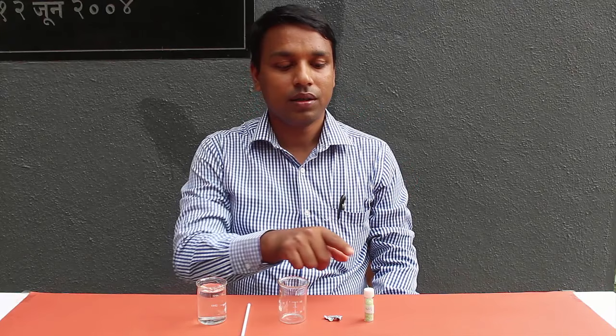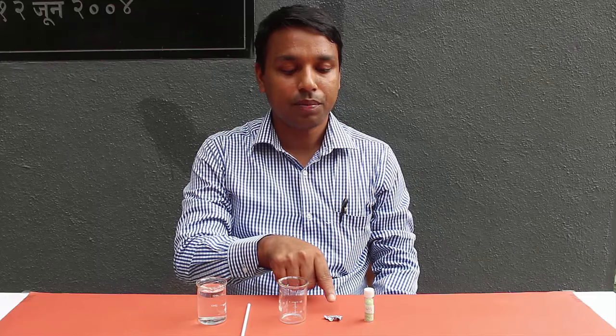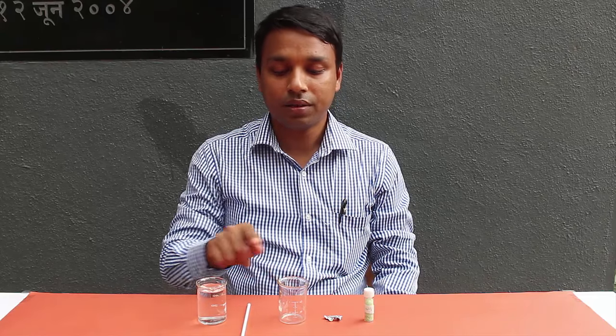Today we are going to discuss about the displacement reaction. For this we need some crystals of ferrous sulphate, metal of zinc, a beaker, one stirrer, and a beaker full of water.